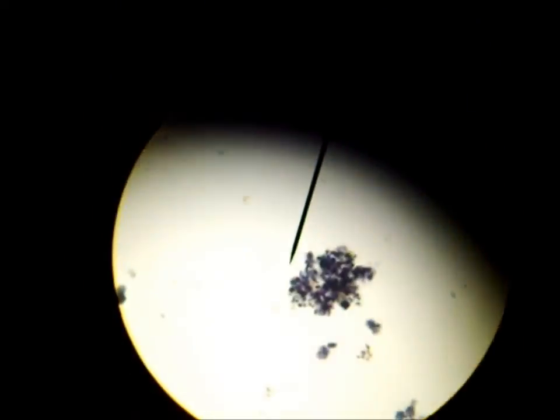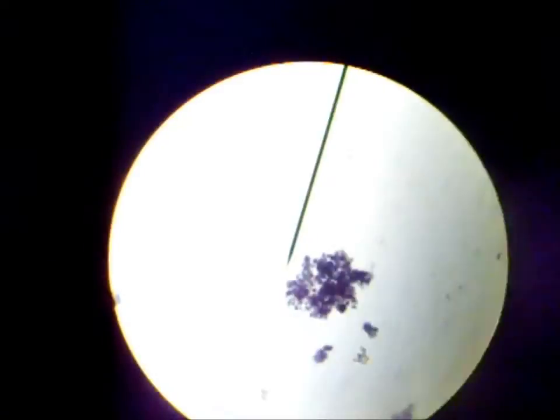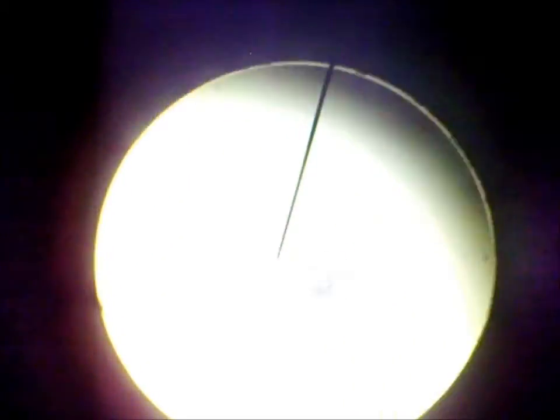This one coming into focus is cyanobacteria Gloeocapsa — that's G-L-O-E-O-C-A-P-S-A.